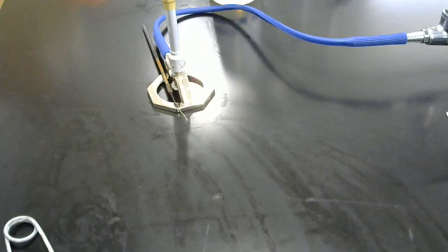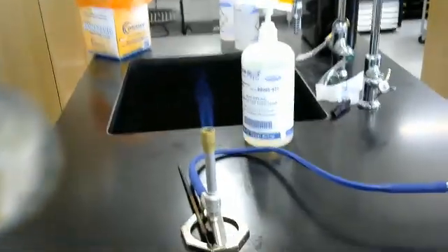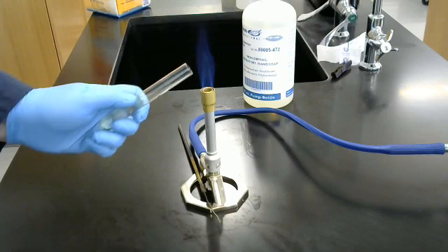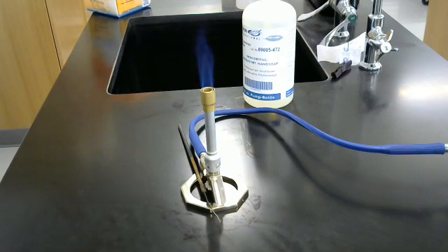Nutrient gel stabs. Here is our needle. And here is our gelatin. Same thing as before, one, two, three, come in, grab some bacteria, and you should be able to see a little bit of bacteria on there.